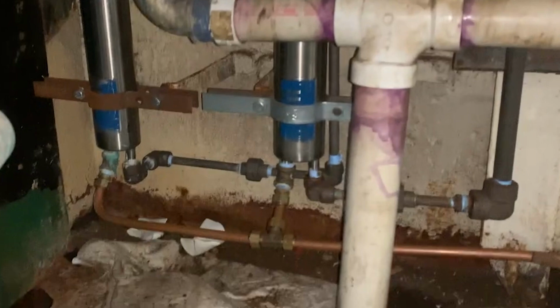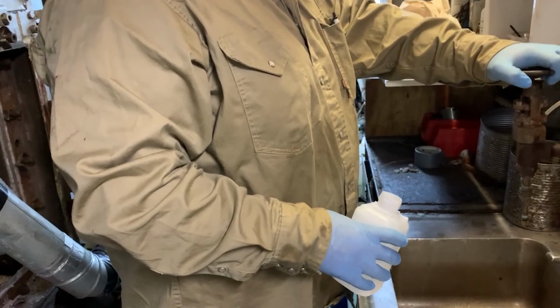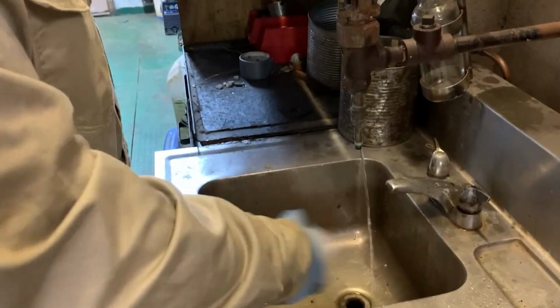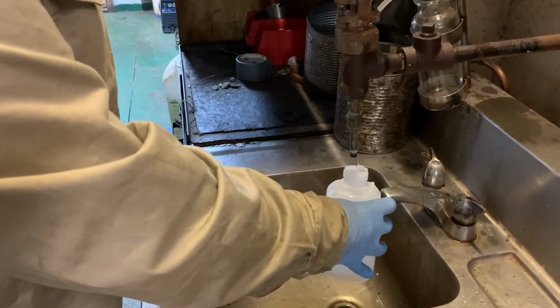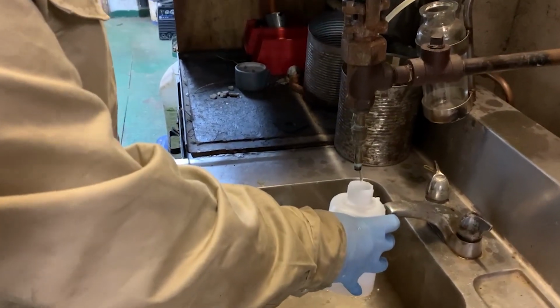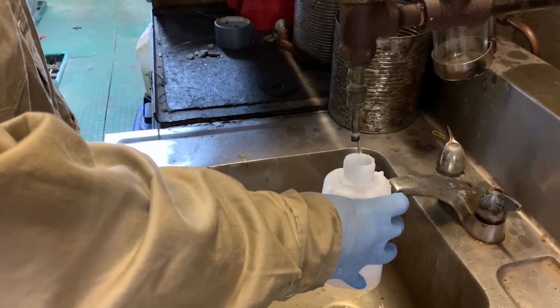Samples should always be collected in a cooled condition through a closed cooler to avoid the loss of volatile constituents of the treatment chemical or contamination and oxygen ingress from the engine room air. Samples should be cooled to 25 degrees Celsius or 77 degrees Fahrenheit. At the very least, samples collected in a container shall be kept closed when being moved to the testing area.